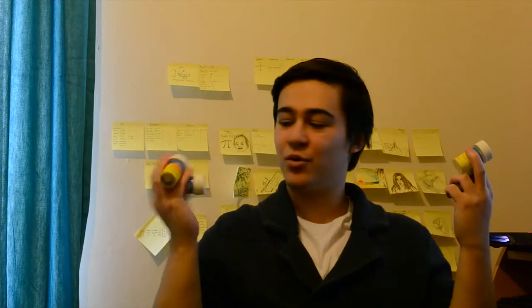As you can see, it's a bit worse for wear, hence why I don't want to use my lighter for this. To do this, we're going to be doing flame tests, which is where you test to find out what metal ions you have in a compound by burning them. Each one burns a different colour. I've got my chemicals, I have my spirit burner. Let's do some science.